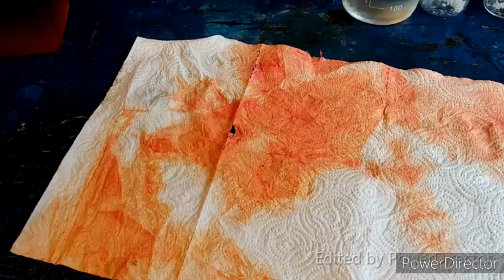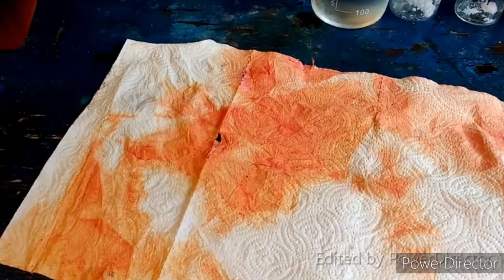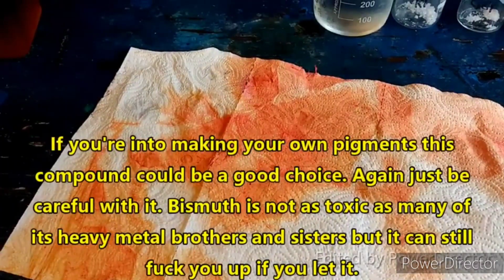And there you go. It does a really decent reddish orange color, more orange than red. I don't know if the camera is showing you that, although over here it looks more red than orange. Maybe you need a thicker layer of it. But hey, as a pigment you can make yourself, it is pretty cool.